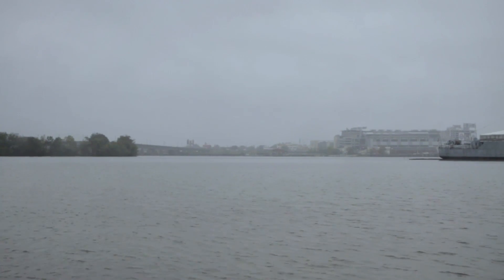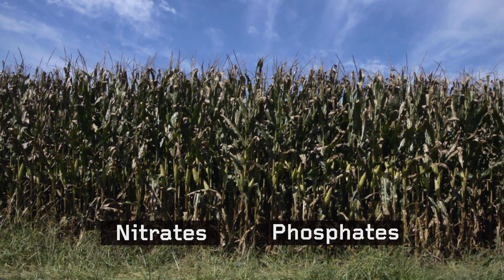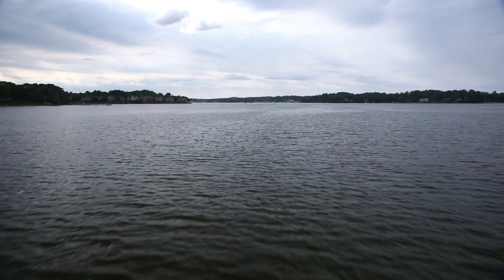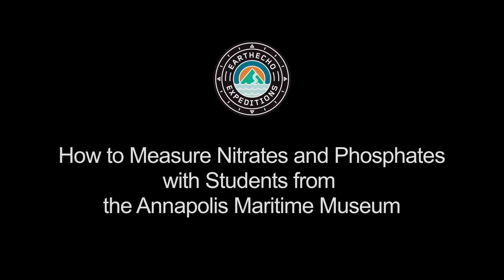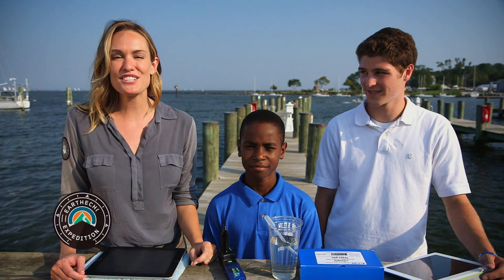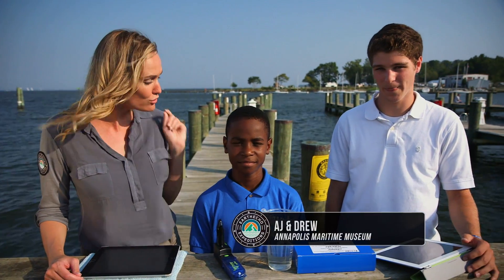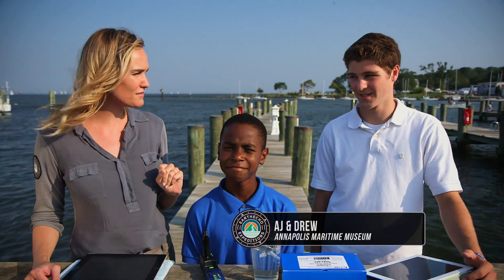A major cause of dead zones is an increased nutrient load in our waterways. Excess nitrates and phosphates that come from human activities are the most significant contributors to this problem. Ashlyn here at the Annapolis Maritime Museum, and we are going to learn how to test for nitrates and phosphates.